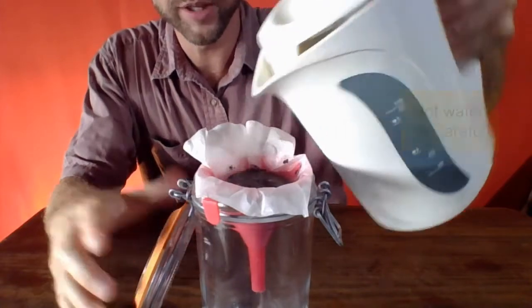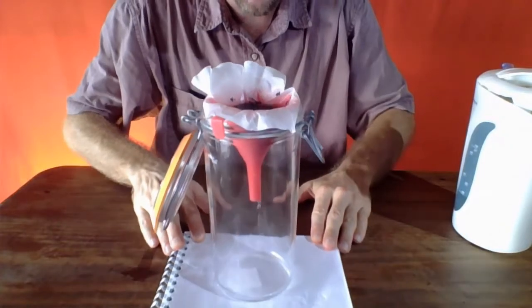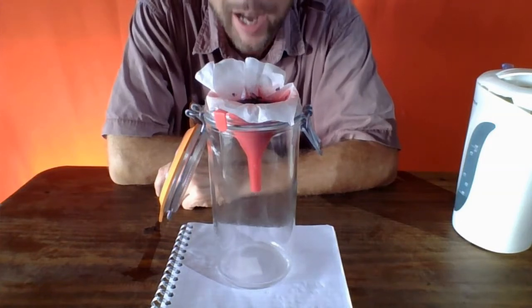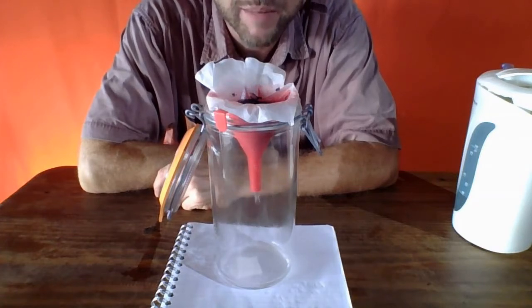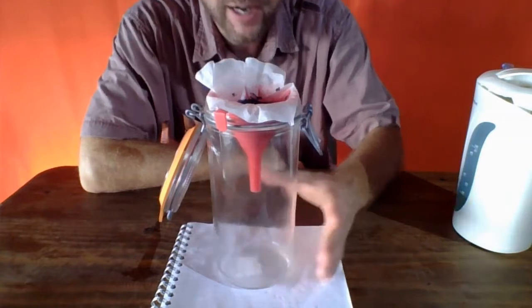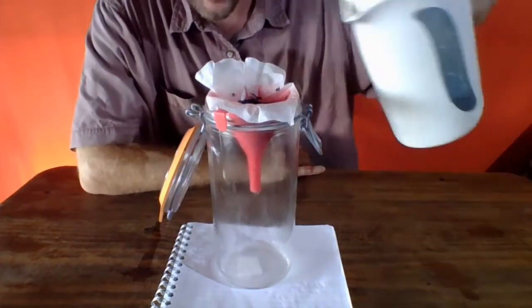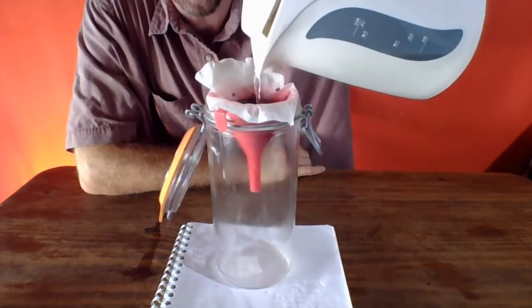We're going to pour slowly, and we can see the drip. Maybe give a little better view. We can see that it's dripping down. You can still notice some liquid level on top, and this is going to take some time. We're going to be patient, and again, you want to be careful, especially if you're using hot or warm water. You can always just use cold water and be a little more patient. So I can see it starting to move down through the filter.